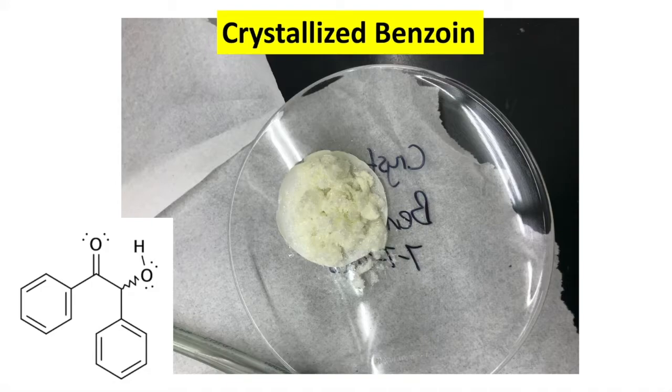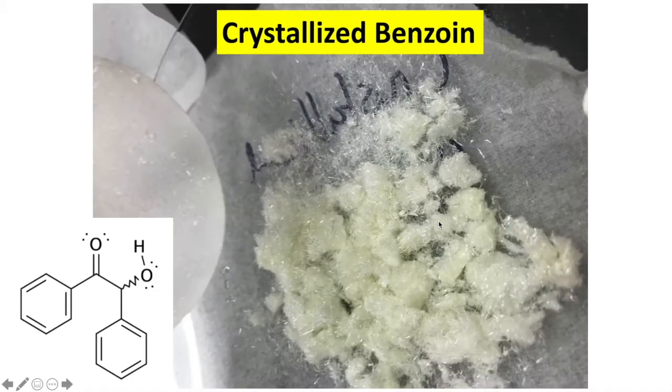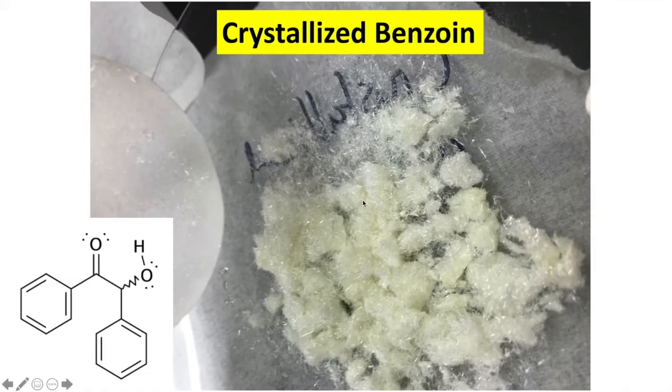So as I did before with the crude benzoin, here's our crystallized benzoin. I carefully took the filter paper with the crystals out of the Buchner funnel, and then I gently scraped them onto the pre-weighed watch glass with my spatula, and they look really nice. They're a little tint of yellow, which suggests maybe a little bit of impurity, but I bet that's way less than 1% is my guess. They look really nice. Look at that.